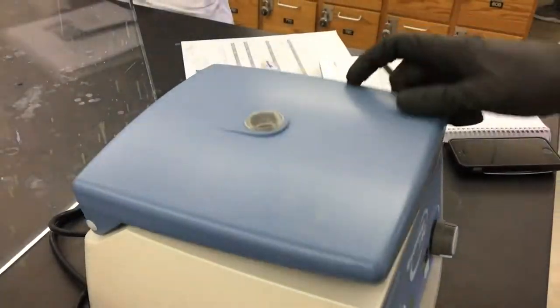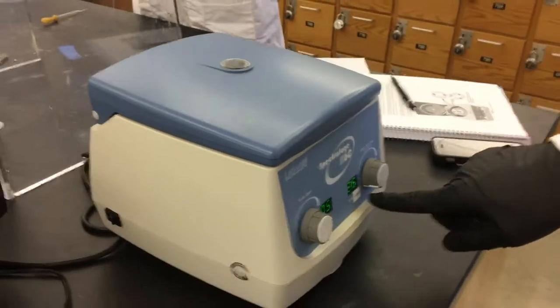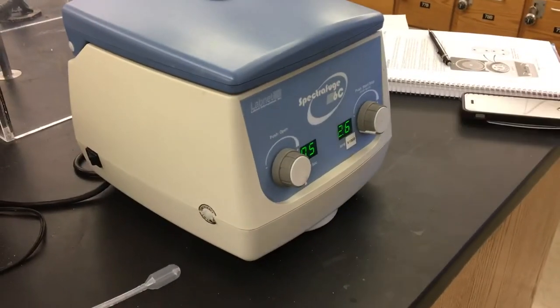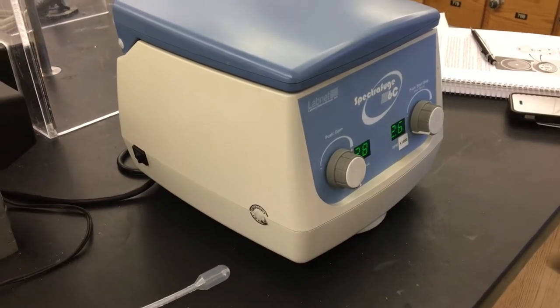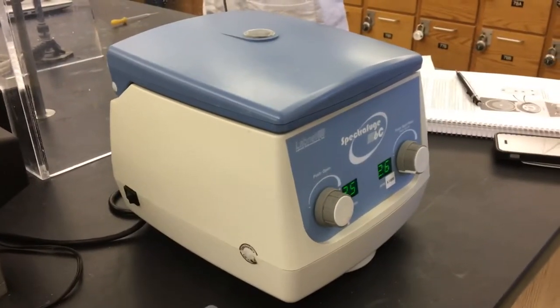Close the lid. Set the time and the speed that you want. And then click the start button, and this will centrifuge.